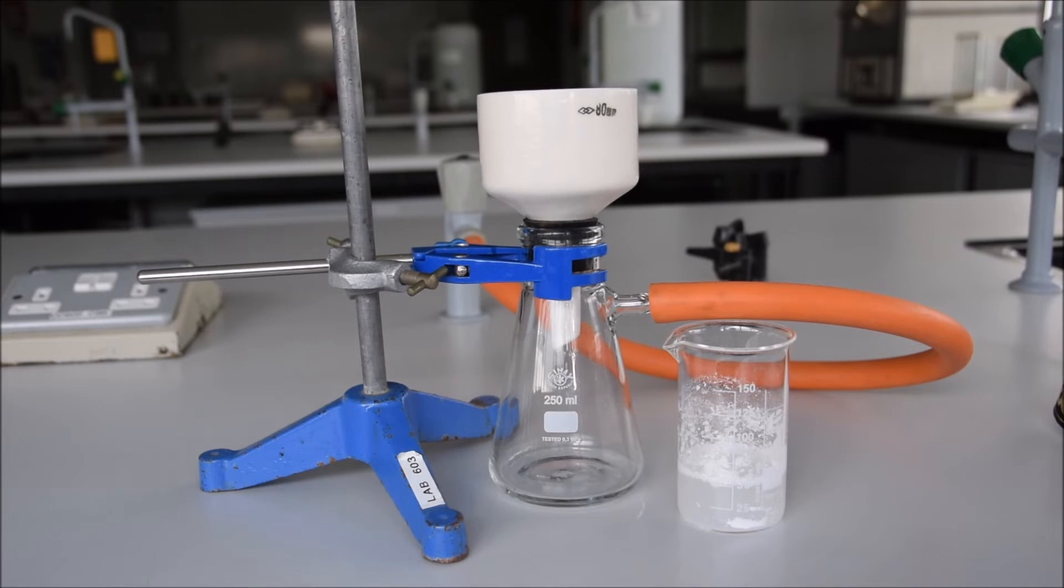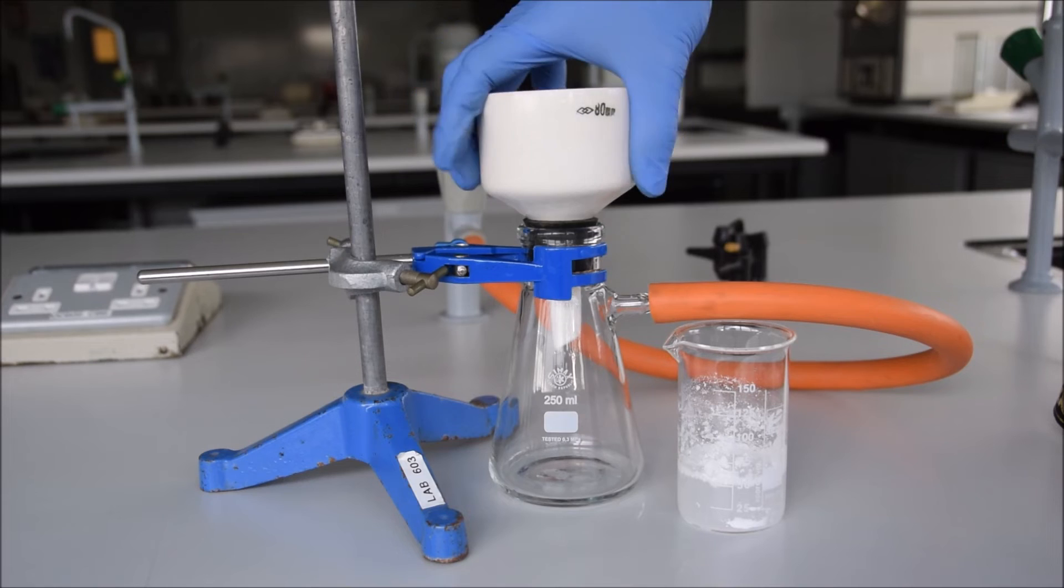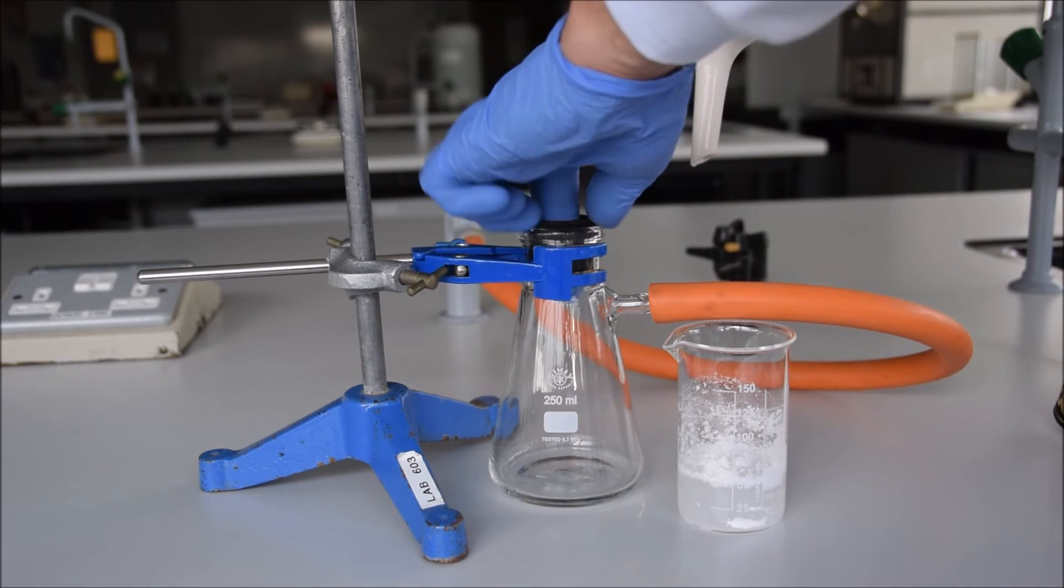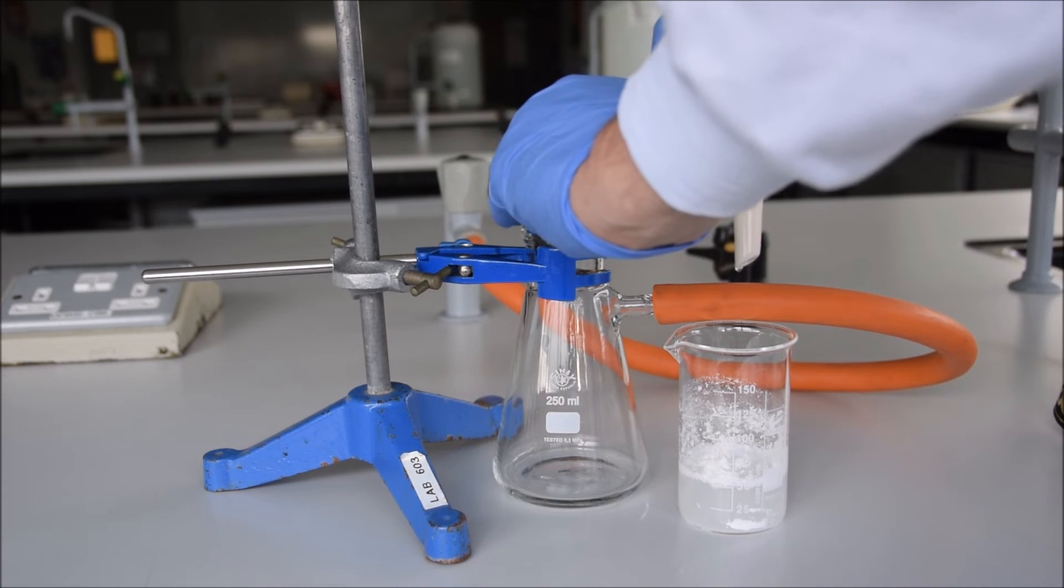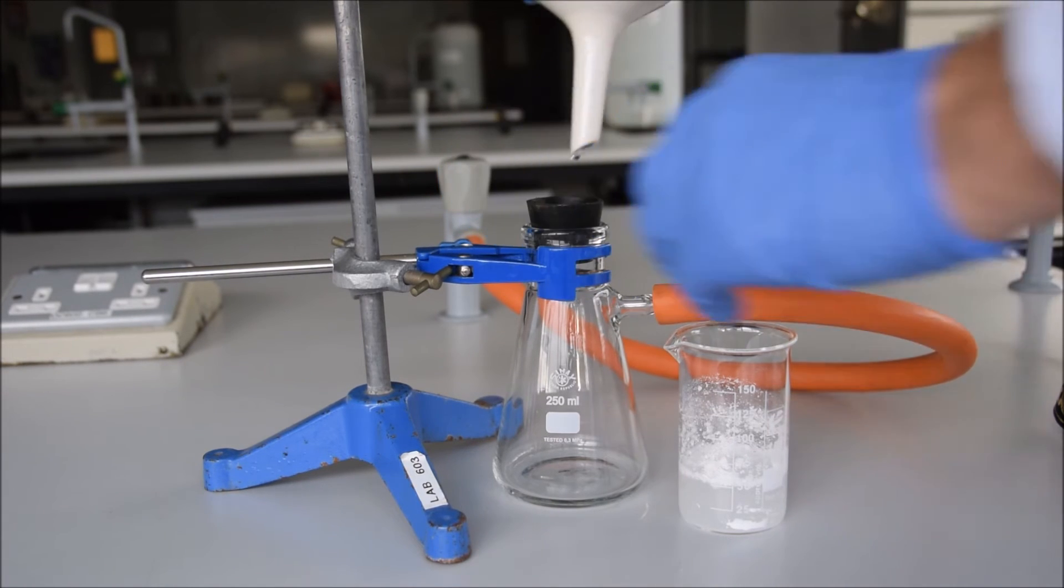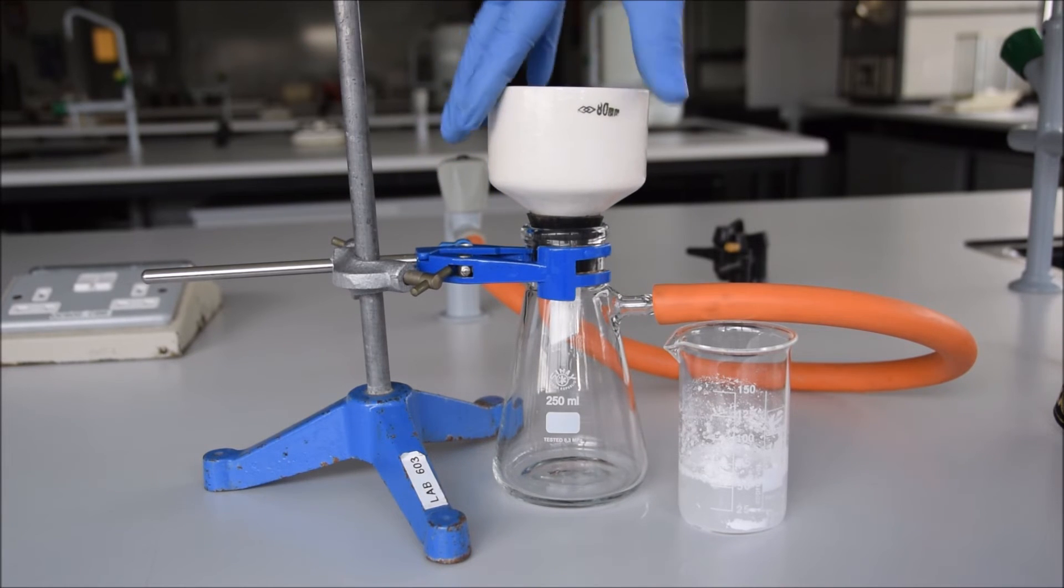Well, firstly you've got to make sure that you have your gasket seated right. You want to have it so that it's just above the rim of the flask. If it's not above the rim of the flask it won't engage and your vacuum won't pull liquid through, and more than likely your filter paper will start to float and you'll get material throughout the funnel and a mess, and you'll have to wash it through and start again. So just make sure that's how it's going.